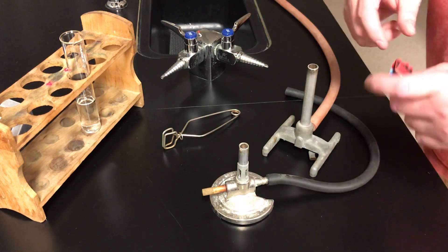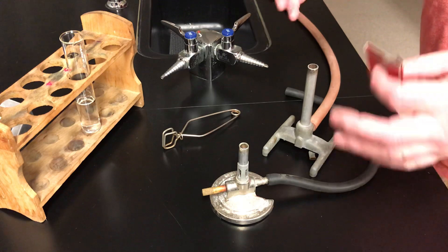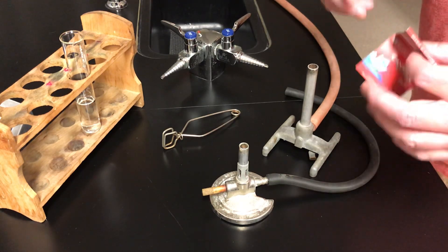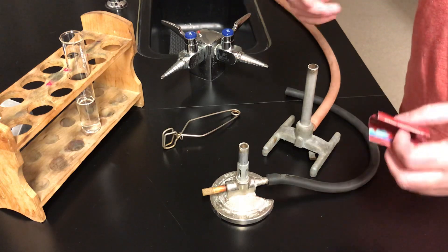In this week's lab, we're going to be using for the first time a micro Bunsen burner. So I'm going to show you in this video how to light the burner and use it safely.